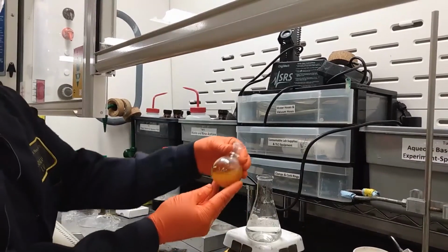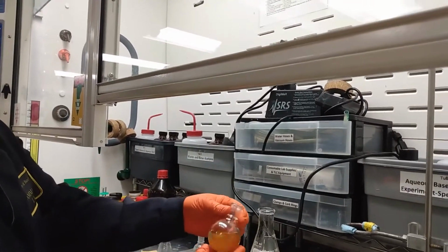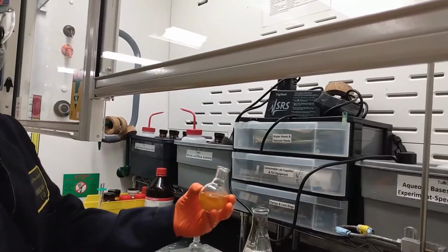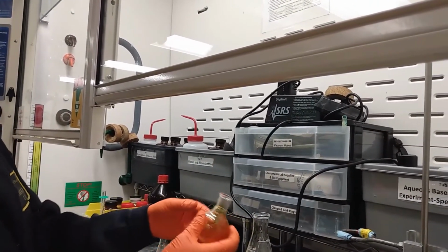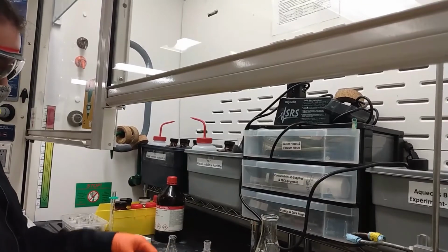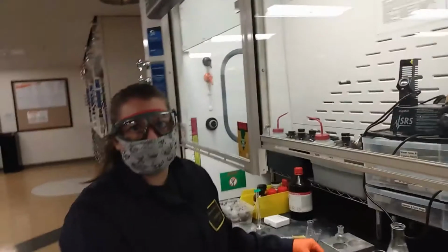So when I let it sit, we can start seeing that opaque color go away and see more of a clear. I'm going to add just a little bit more, because we want to add just enough. All right. And now that we have our methanol in it, we want to let this cool in our ice bath for about 10-15 minutes, and we'll see our recrystallized product form from that.